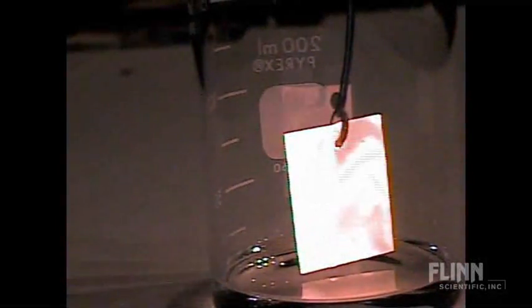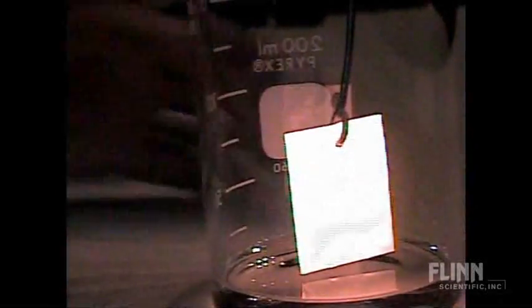I love that. You can do it with a penny too. I just used the copper strip because it was a little bit bigger for today. Now watch what happens when I pull this out of here though. Watch how fast it cools off. I'm not touching the beaker. That would be foolish. That would really not be smart. Alright, here it comes out.